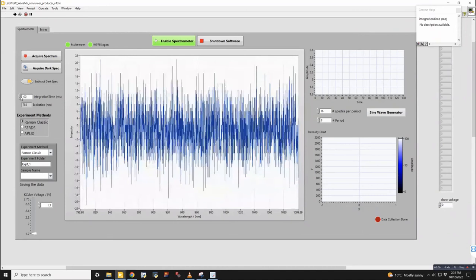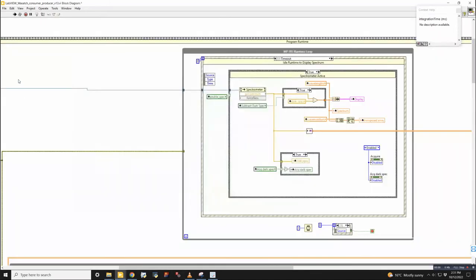So that's the basic operation of how the two pieces of hardware work. Are there any questions about that yet?